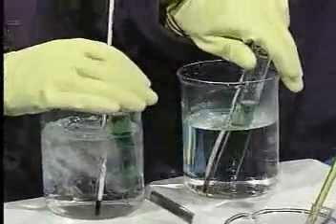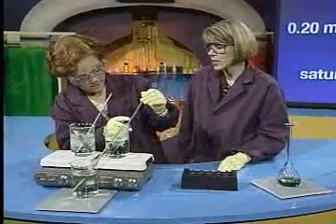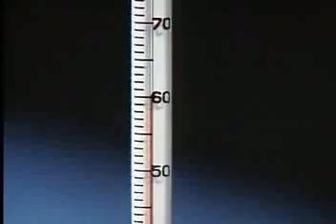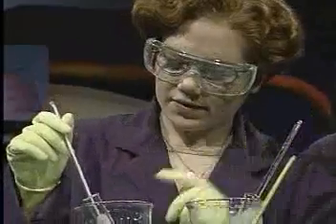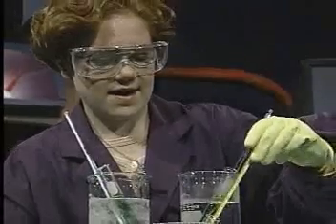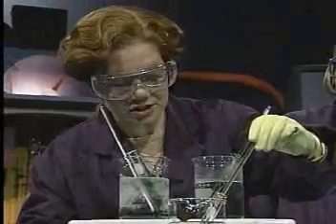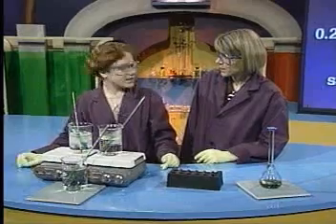Now, Amy, can you take a temperature reading just to verify that I have these right temperature ranges? The hot water bath has a temperature of 60 degrees Celsius. All right. The cool water bath has a temperature of 4 degrees Celsius. And the one at room temperature is at 25 degrees Celsius. Good. But what's happening in these test tubes?